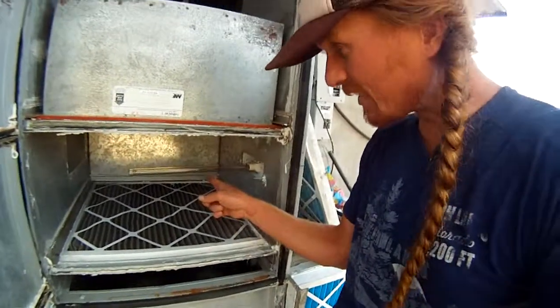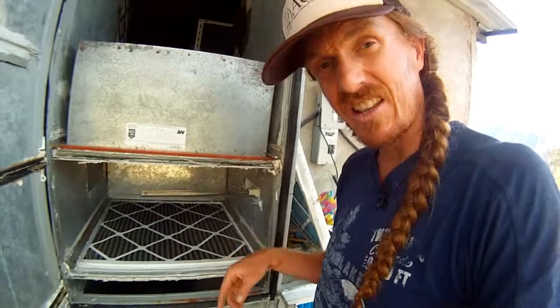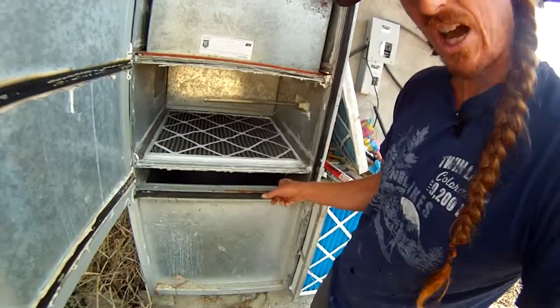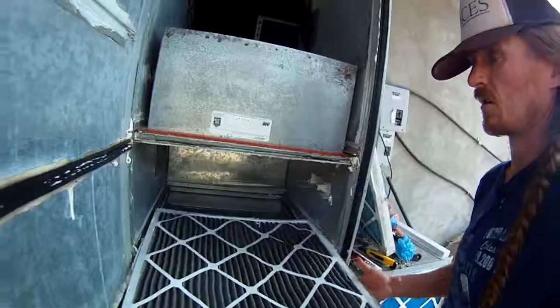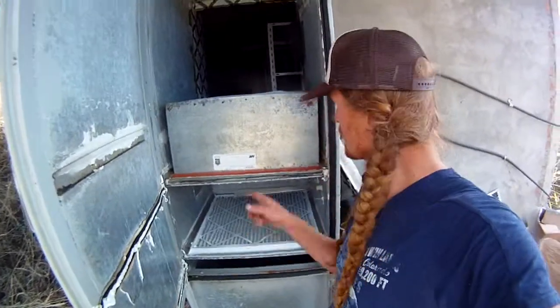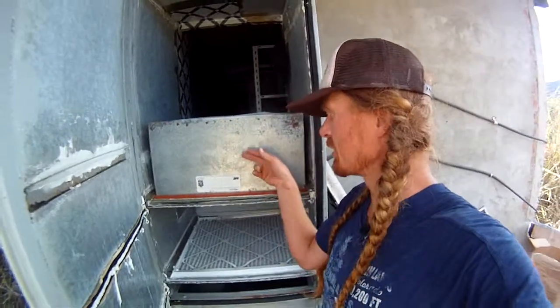And then I even get wild, and I've got one of these UV lights in here to kill anything in there if I need to. It's not totally necessary, but it's there, and I've left it there. From down in there, that's where the blower pushes out, goes up through here, and into the lab. So what I'm gonna do here is change out this filter to protect this one. You can see I got my seals, so when the door shuts, it lines up right on that. So I got my new filter in there. This HEPA I replaced actually 2 years ago. It will last for a while as long as I keep these pre-filters clean and rolling.